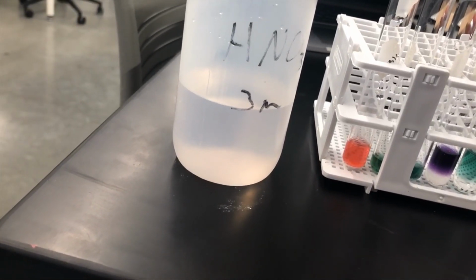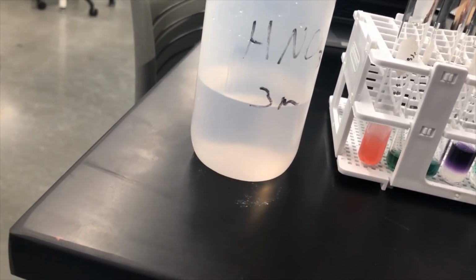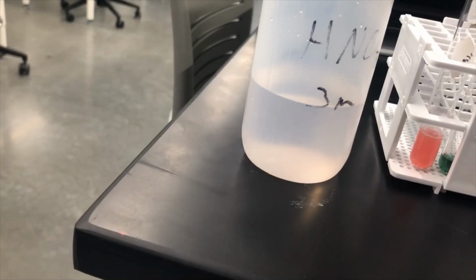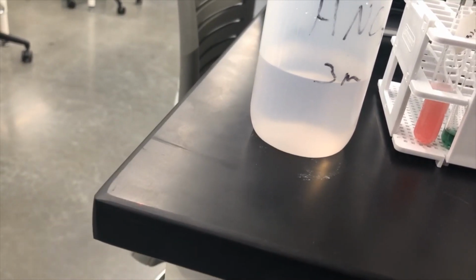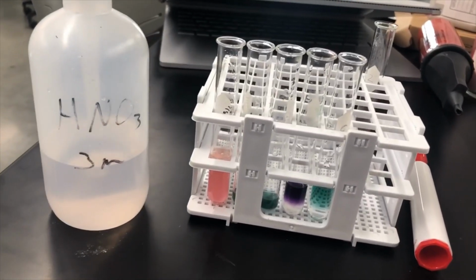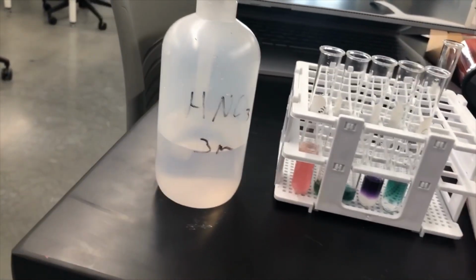Well, look at that. We are seeing some bubbling with this first guy. Now, everything is kind of semi-soluble, so even though there was a precipitate there, that means that there were still a few carbonate ions in solution. So red plus fizzing.